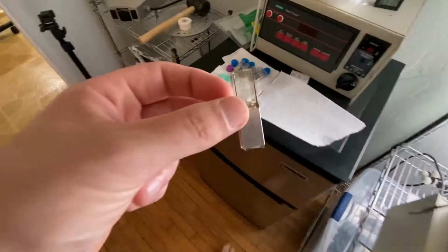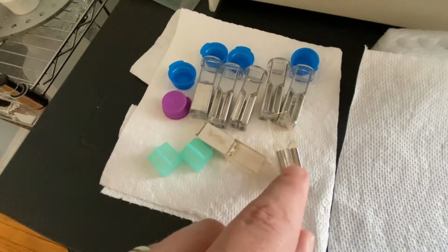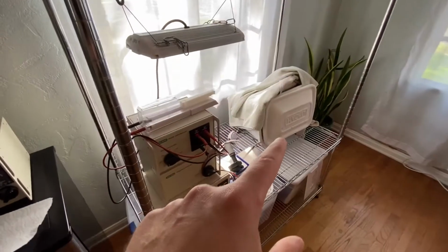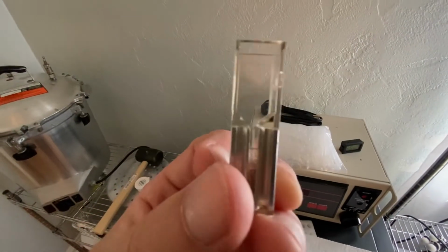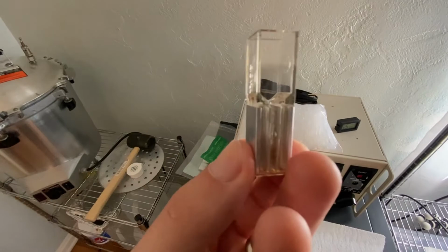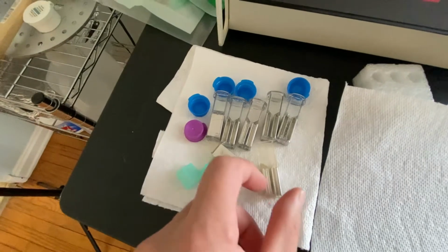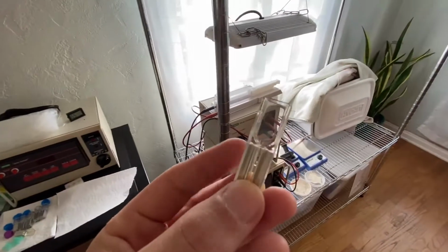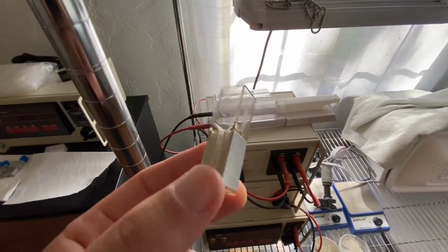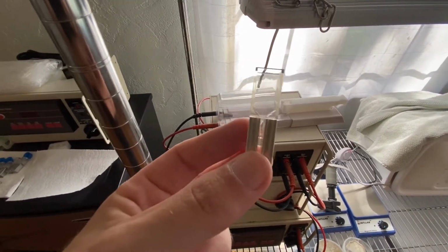So the protocols call for immediately recovering these by adding 1 milliliter of LB broth to this, that you then suck up and put into a tube and then put into the incubator in order to recover those cells. And I have struggled from the beginning with getting the appropriate amount of LB media in these. One, because the pipettes don't really fit down into that small hole. So I've been using these very small pipettes to try to get the LB broth in here. And when we run this, we're only putting 40 microliters of the dilute bacteria suspension in here. So when we run this with DNA, not all the cells are going to get transformed, only some of them will get transformed.